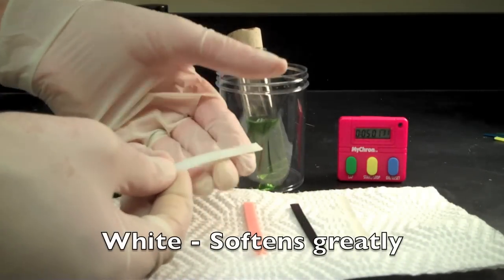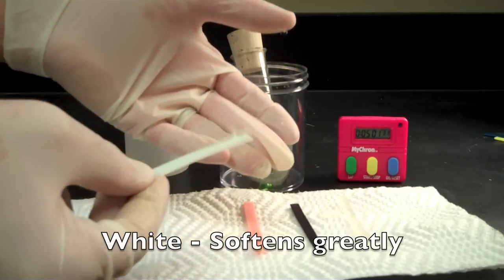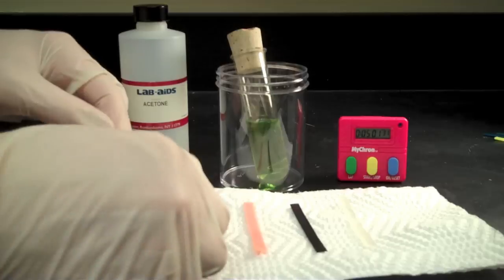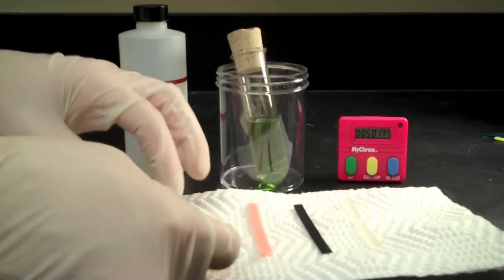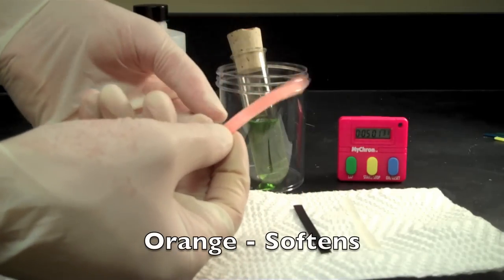The strip of white plastic has softened greatly and you can see it's very sticky and is sticking to my gloves. The strip of orange plastic has softened and is more flexible than before.